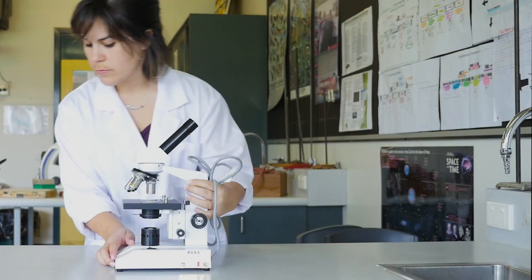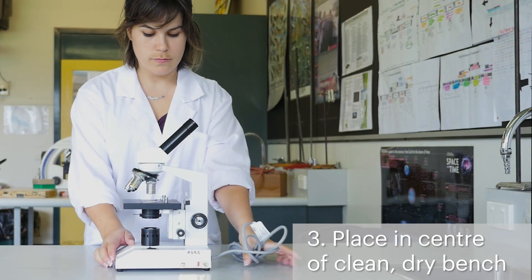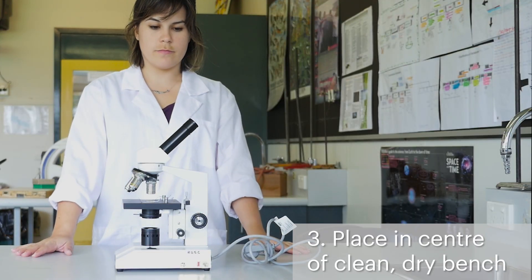Check that the bench is clean and dry. Place the microscope down gently towards the center of the bench to reduce the risk of knocking it off.